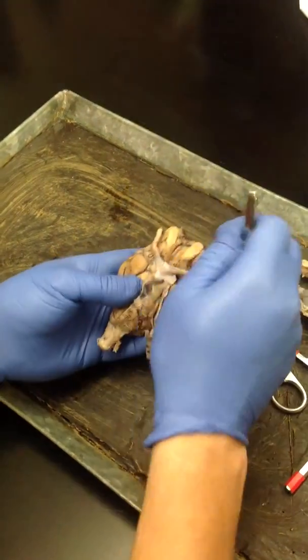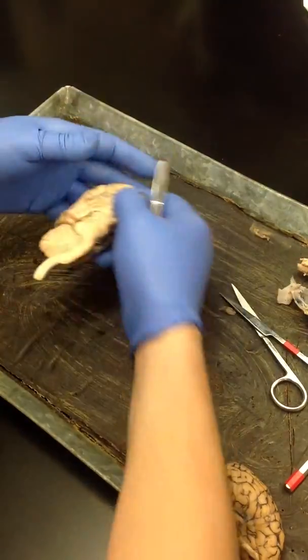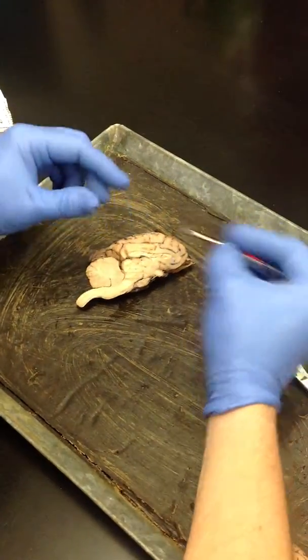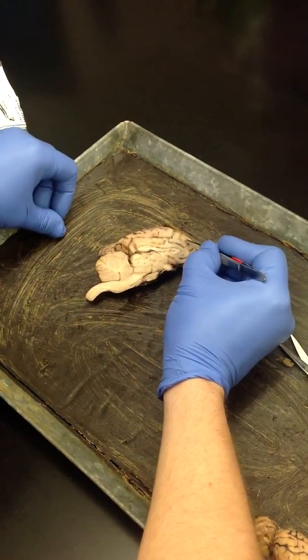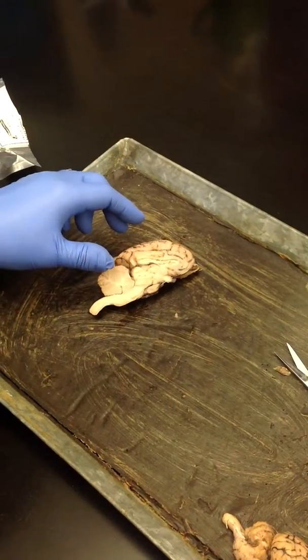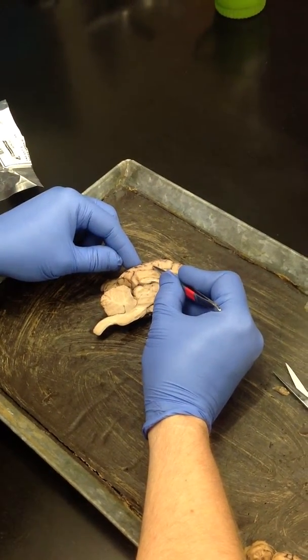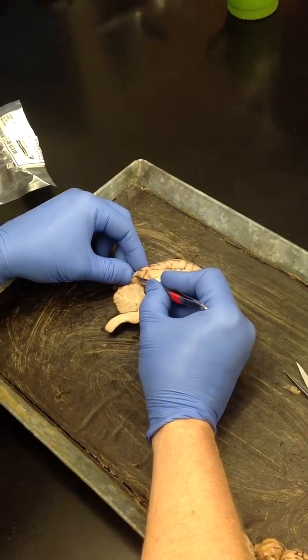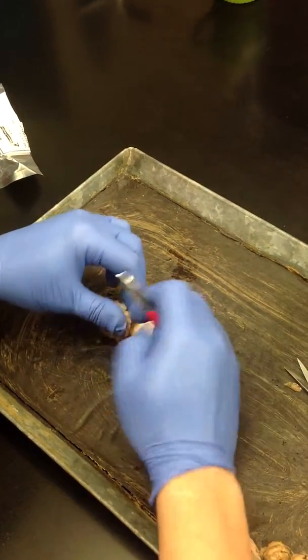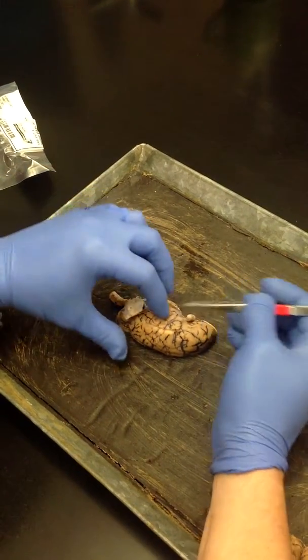So when we do our mid-sagittal cut, it's like this. From a mid-sagittal cut, if I put the pin here, you would tell me that's frontal lobe. So whether I put it here or I do it as a whole brain, shouldn't matter. Back here would be the parietal lobe, and then all the way back here would be the occipital lobe. Temporal lobe, I would have to come out here on the lateral side to label.